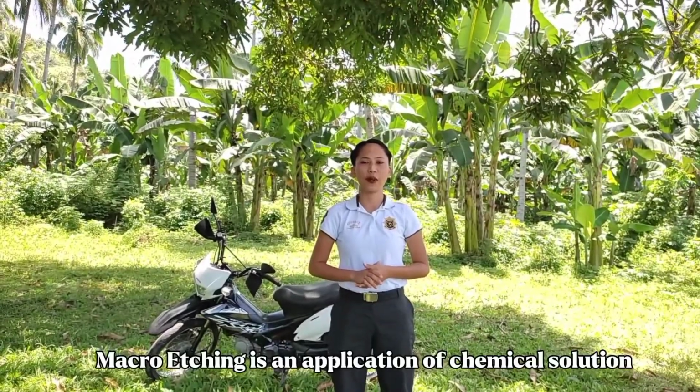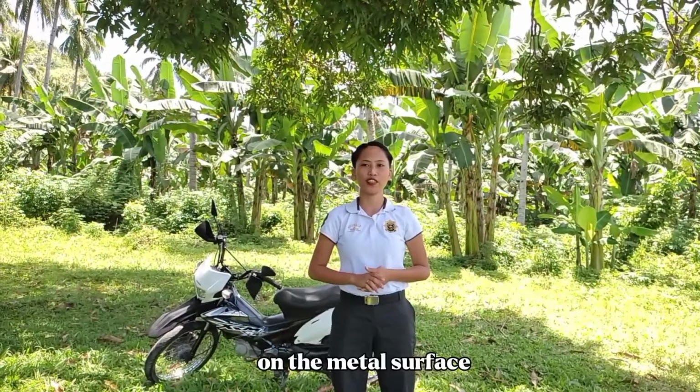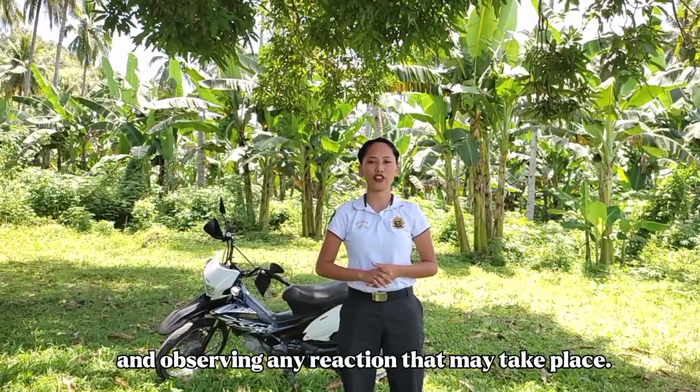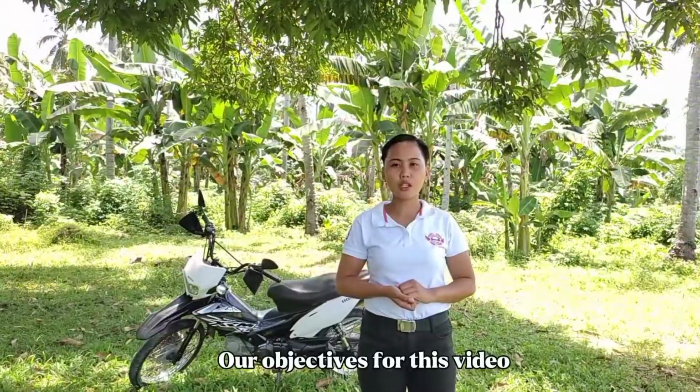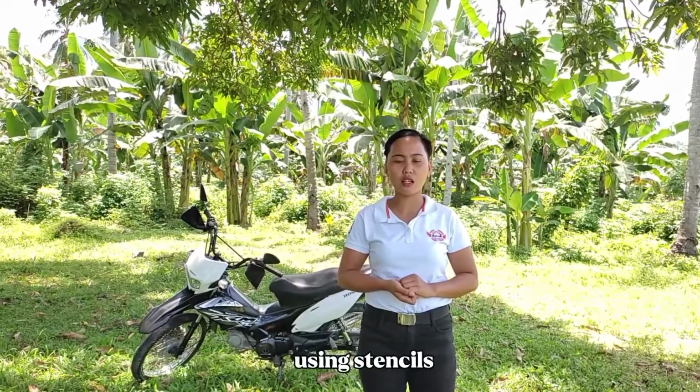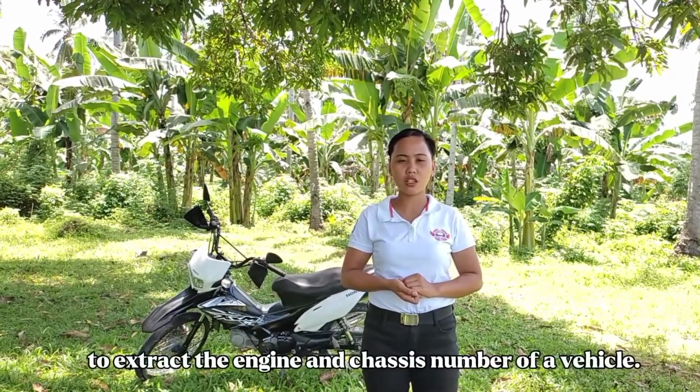Macro-etching is an application of chemical solution on the metal surface where the serial number is normally located and observing any reaction that may take place. Our objective for this video is to determine the importance of macro etching using stencils to extract the engine and chassis number of a vehicle.